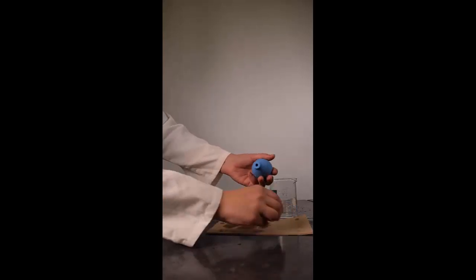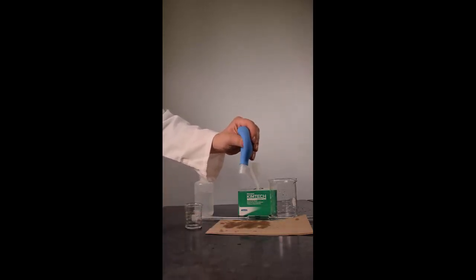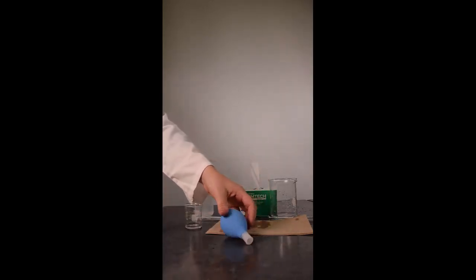Once the bulb is dry, put the adapter back on. You now know how to deal with a contaminated suction bulb.